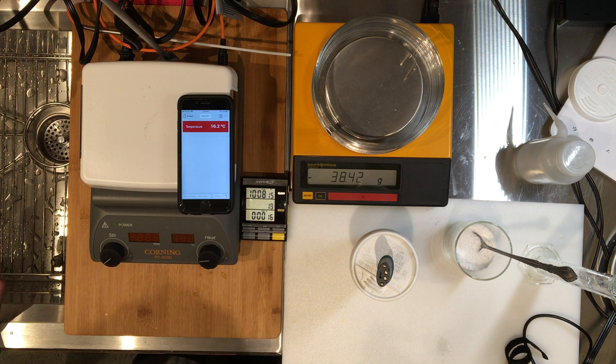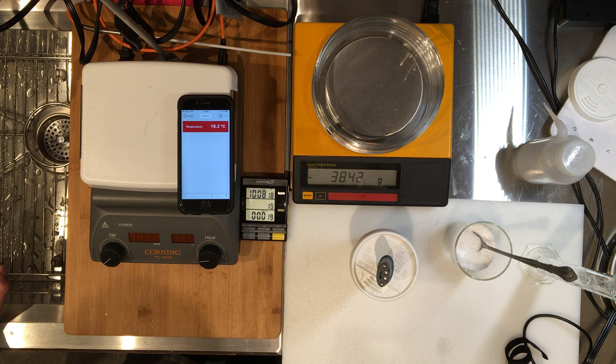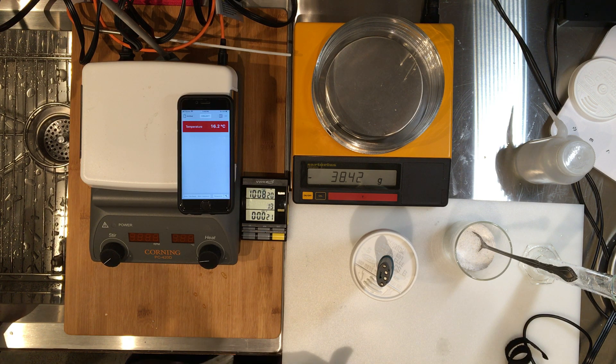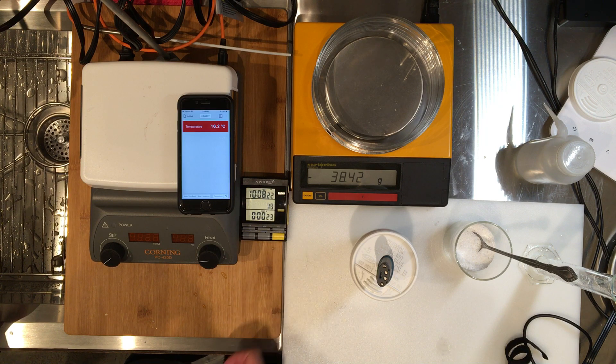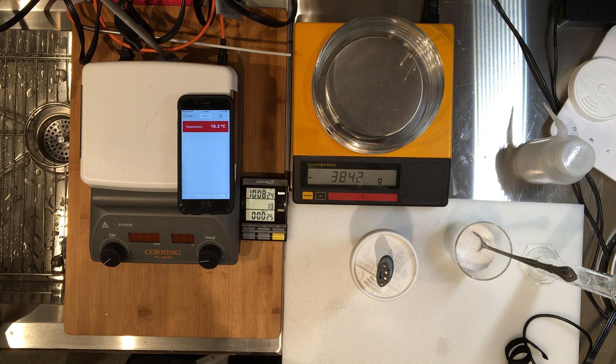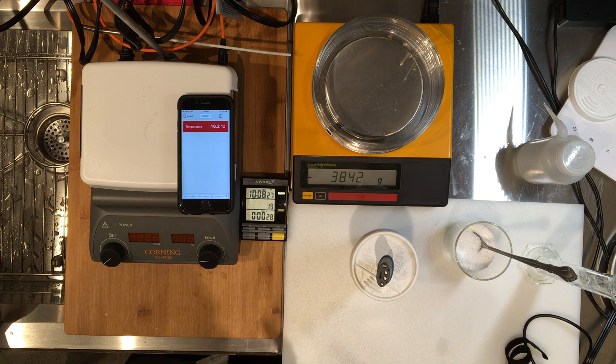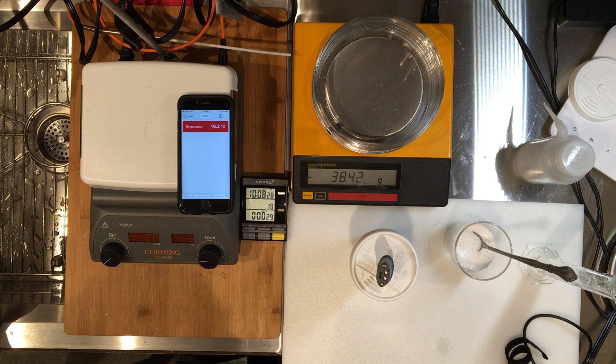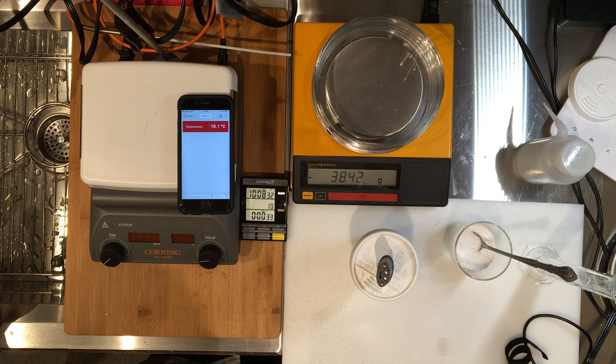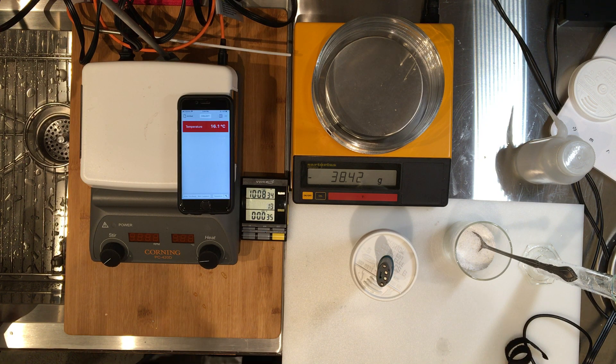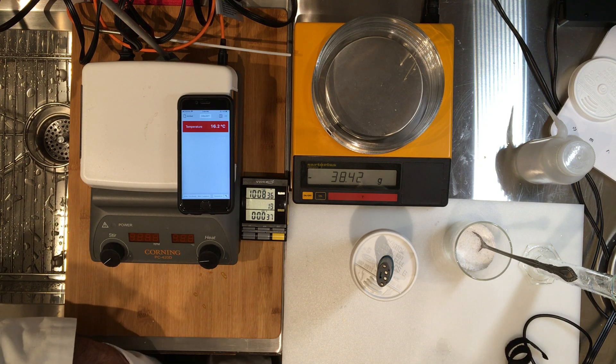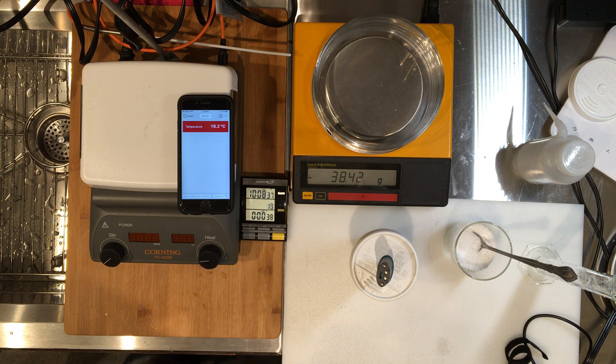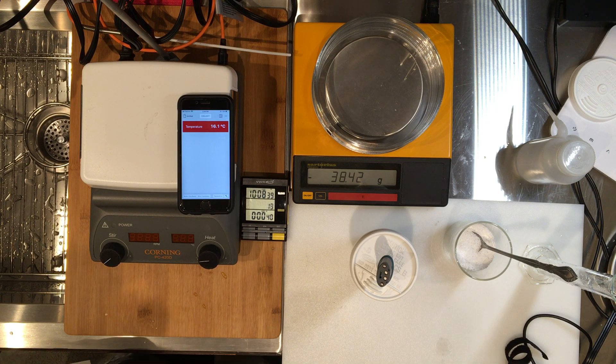Now. And then from now on I'm not going to keep saying now, so keep your eyes on the timer and record it every 15 seconds. Let's keep this going for maybe like one minute, two minutes, and then we will add the chemical. You can see the temperature is pretty constant and that's what we want as the baseline of our graph.